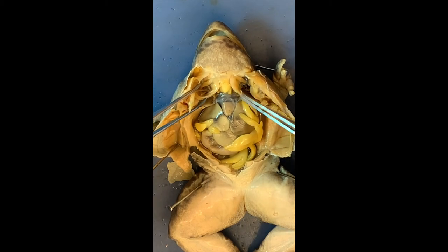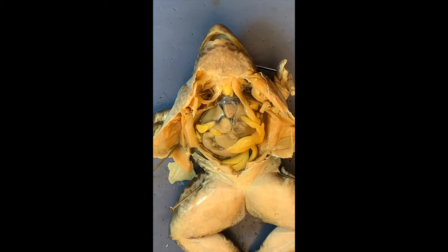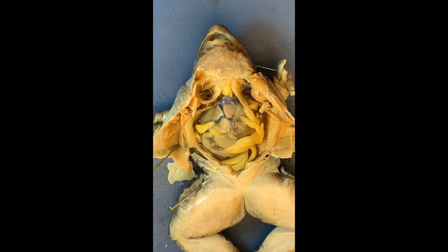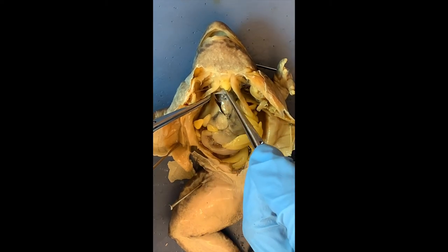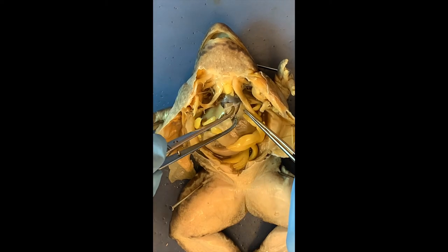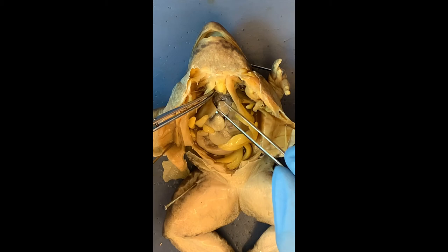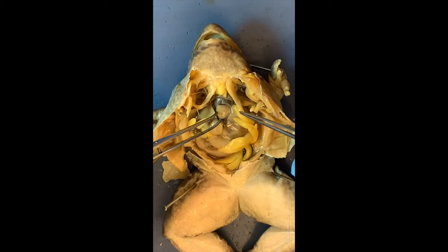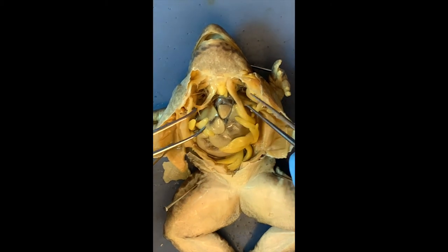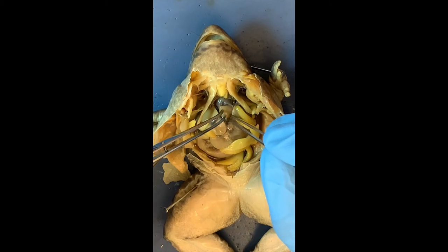Since frogs don't have a diaphragm, they still have to breathe. They have little lungs, and to get air into those lungs they use their throat. You know how you see frogs moving their throats — that's their breathing, they're pushing air into their lungs. Here I'm opening a pouch in which there's the heart. Look at this little heart! It has a heart shape, with the ventricle — the whiter part — and then the atria on top. It's a three-chambered heart: our heart has four chambers — two atria and two ventricles — but frogs have only one ventricle and two atria.